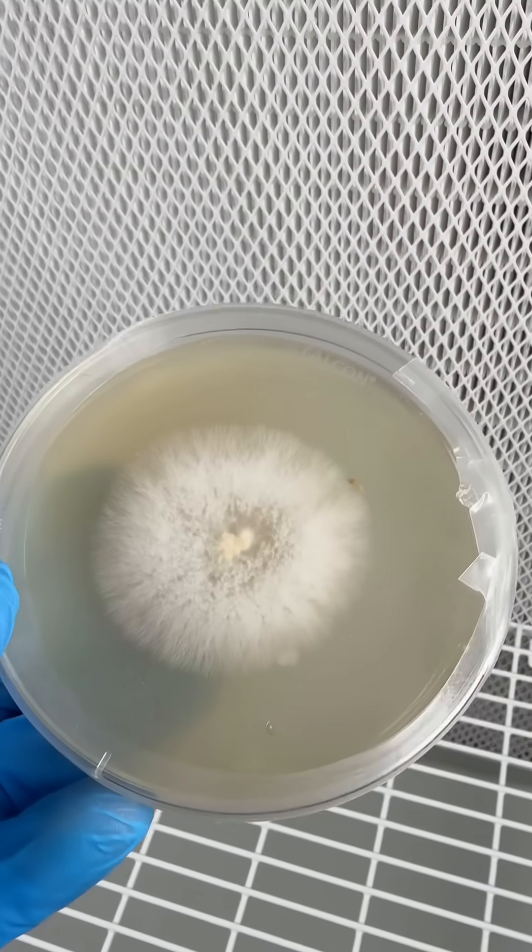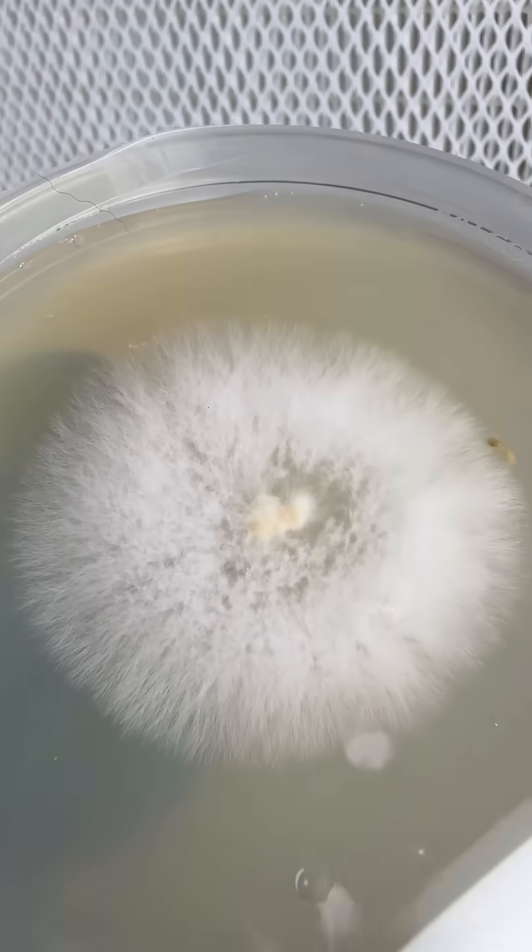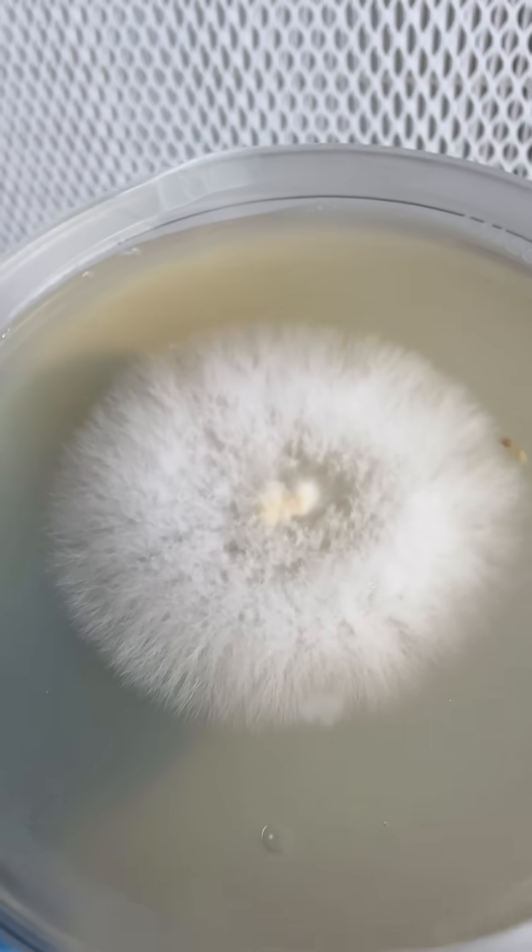After growing for a few days the mycelium is already ready to transfer to new agar plates or to grain spawn to start the whole process over.